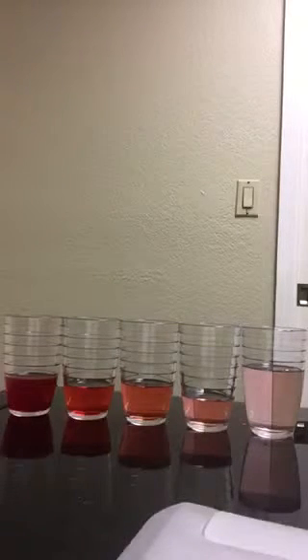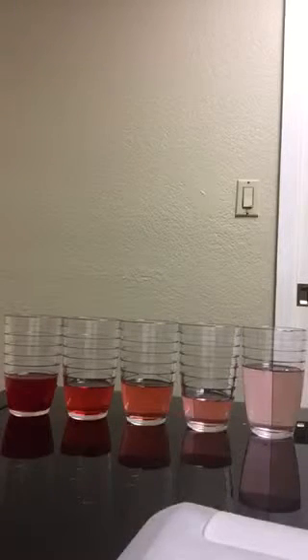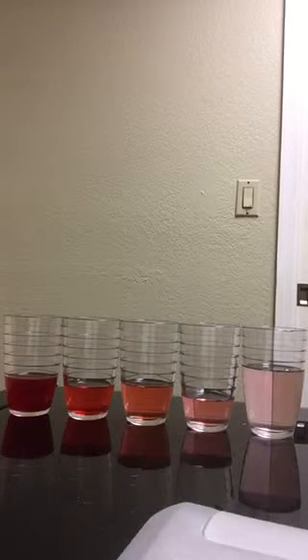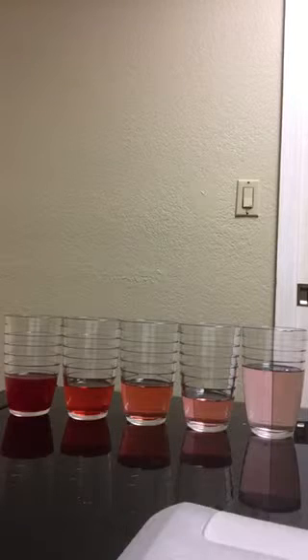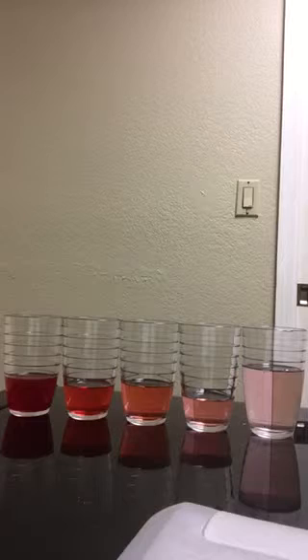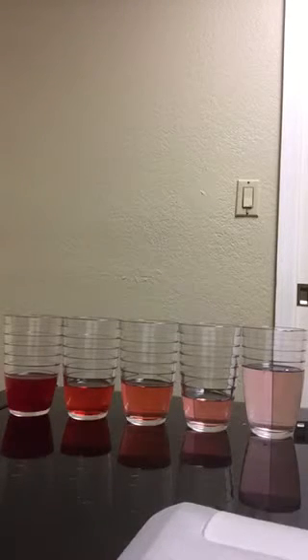Then I transferred 75 milliliters from solution number 3 into cup number 4. I also added 100 milliliters of water. The dilution equation is 0.003, the molarity of solution number 3, multiplied by 75 milliliters, the solution from cup number 3, divided by 175 milliliters, which is the total amount of 75 milliliters transferred from solution number 3 and water, 100 milliliters. This gave me a calculation of 0.001, which serves as the molarity for solution number 4.